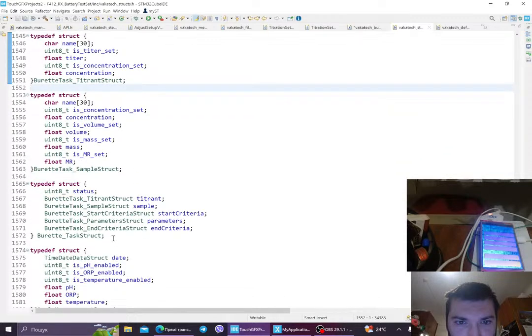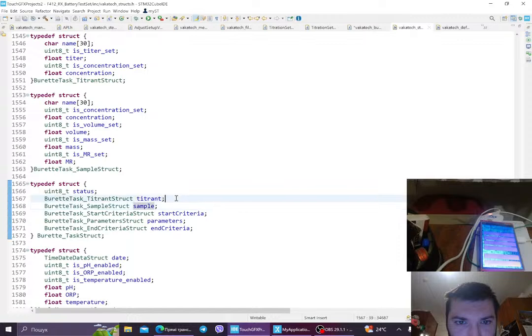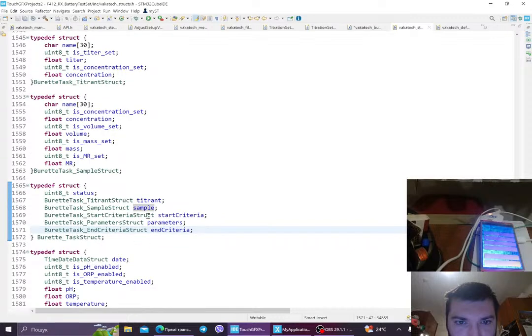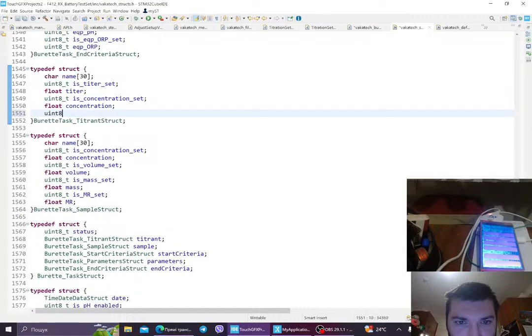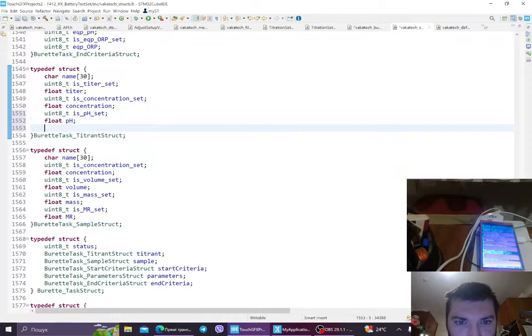And of course, the big task struct for the burette has the titrant, it has the sample, it has the start criteria, parameters, and criteria. And all of this you see here. Still, we are now interested in the titrant, and the titrant struct has the following. It has a name, it has its titer set, titer is concentration set. I would add a pH set, so this is the pH of the titer of our titrant.